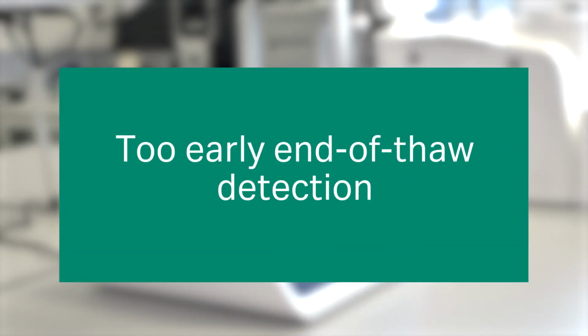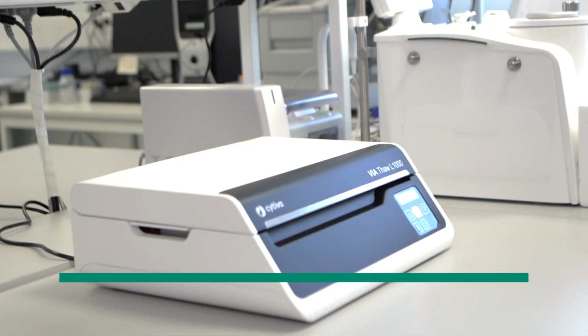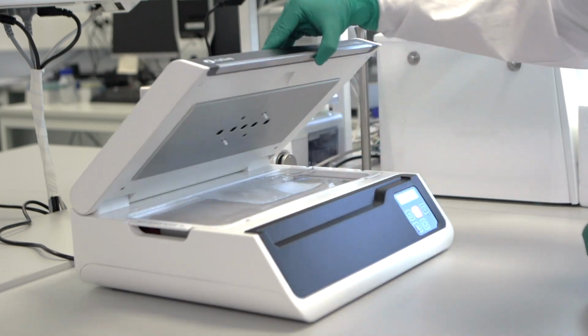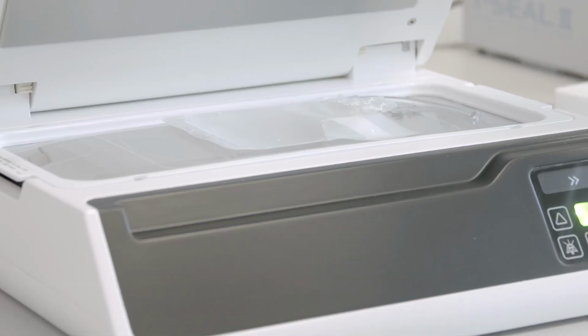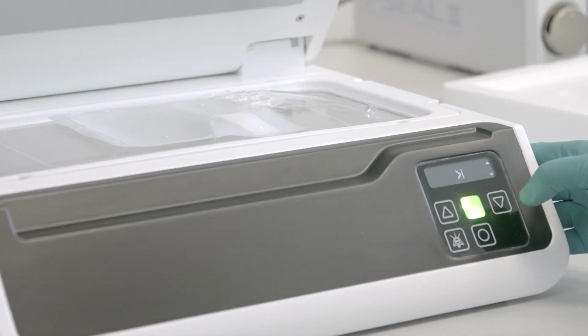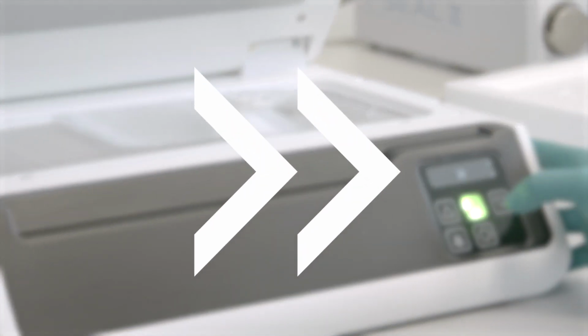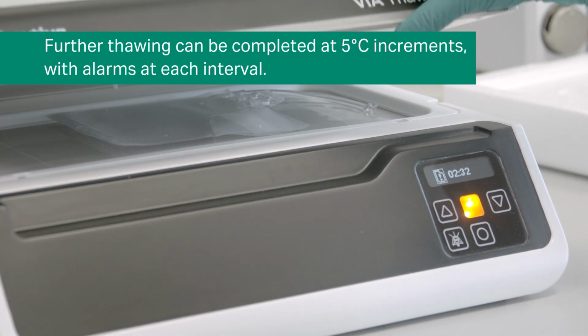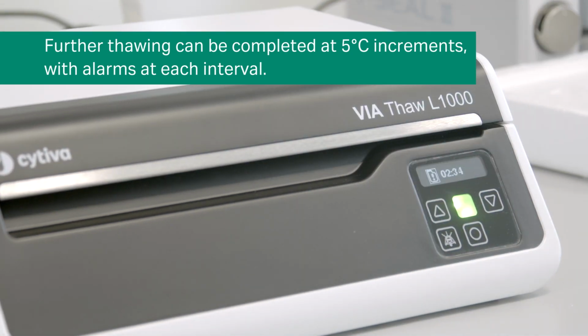The ViaThaw instrument is designed to complete the thawing process when the bag contents are around 5 degrees Celsius. Some small ice crystals, which are typically thawed in 10 or 20 seconds, may still be present. At the end of the process, you may remove the bag or decide to continue thawing. If you decide that further thawing is needed, the ViaThaw instrument will continue the thawing process, stopping at 5 degrees Celsius increments from 5 degrees Celsius, and re-alarm after each interval.